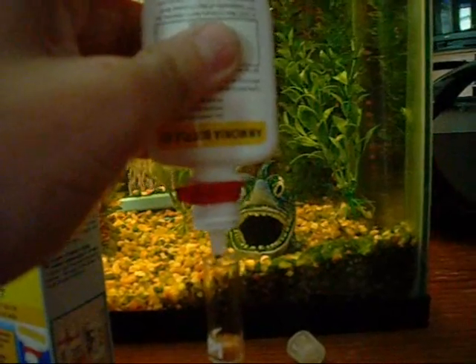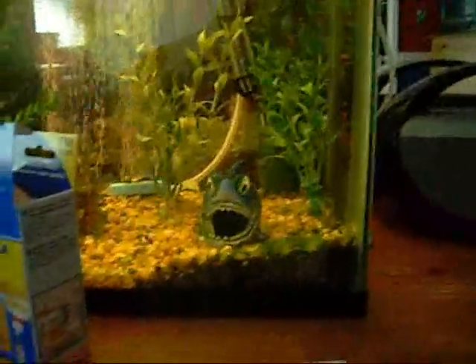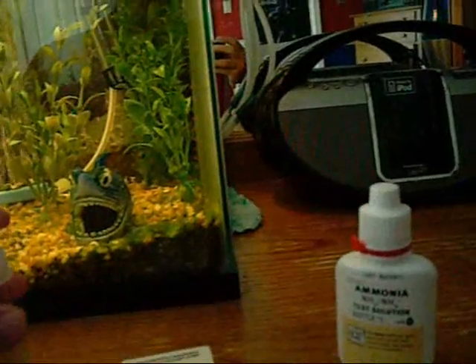4, 5, 6, 7, 8. Close the lids on the test bottles, shake it up, and let it sit for 5 minutes.